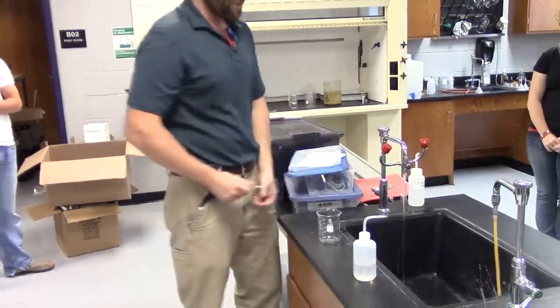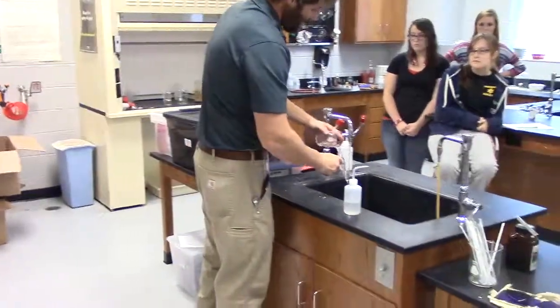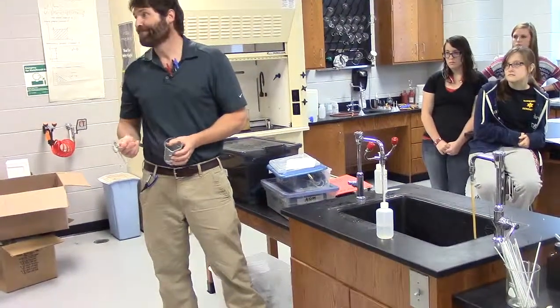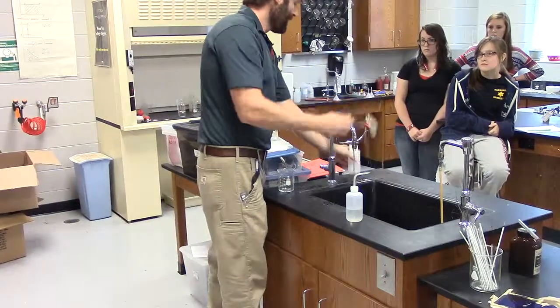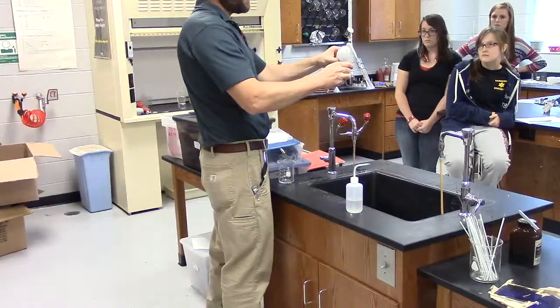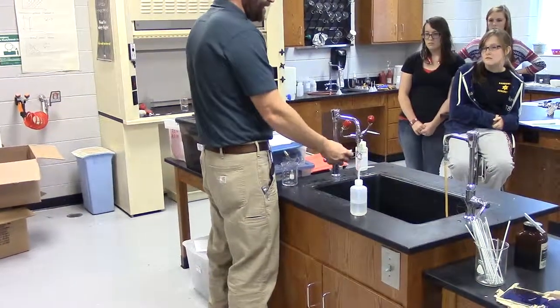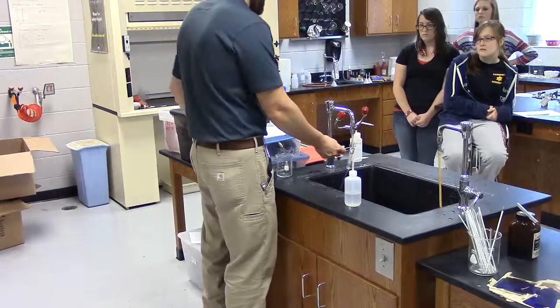Now, hopefully you could actually perform this without doing it. But if you're in doubt, just take a beaker and rinse this thing out about 400 times. In other words, you just keep rinsing it out and rinsing it out till you got the acid out. The soap will be a little basic. Spray some soap in there. You can rinse it out. You get the idea? Rinse it out, rinse it out.